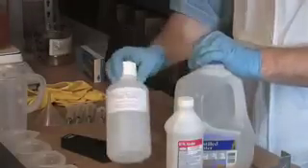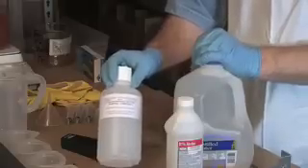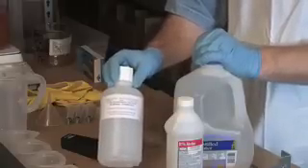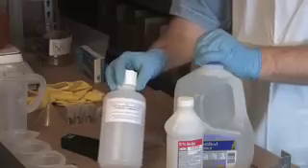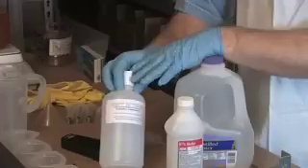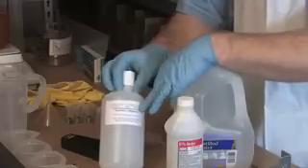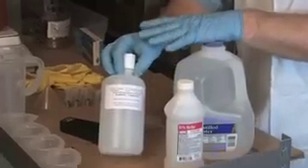I'm going to need a jar or a jug that's sealable that can hold a liter of water, because this is what I'm going to make and put my titration solution in so that I can reuse it multiple times. It's important that if you put it in a jug that may look like water, that you mark it with a warning so that no one ever drinks out of it, because what we're going to make is poisonous.